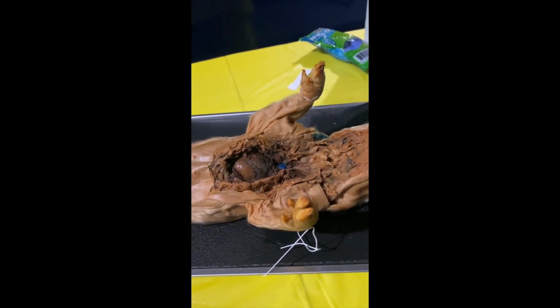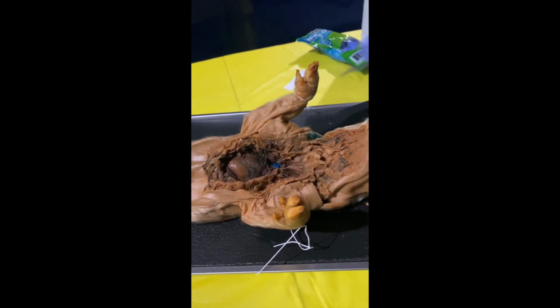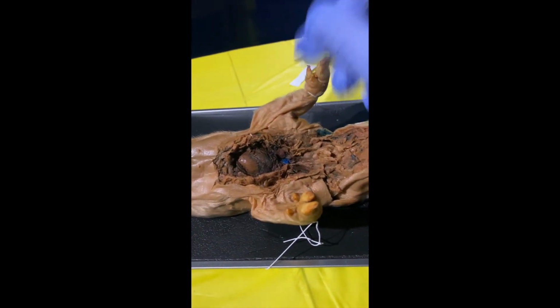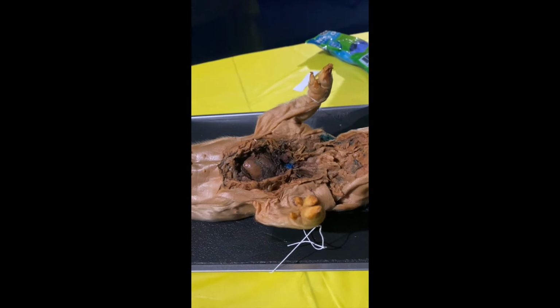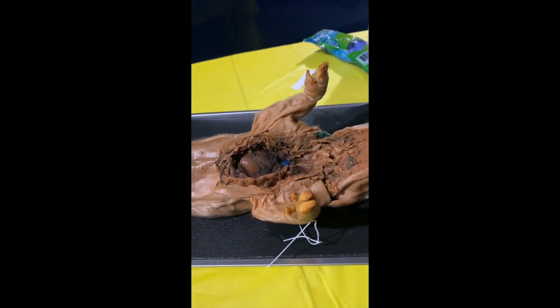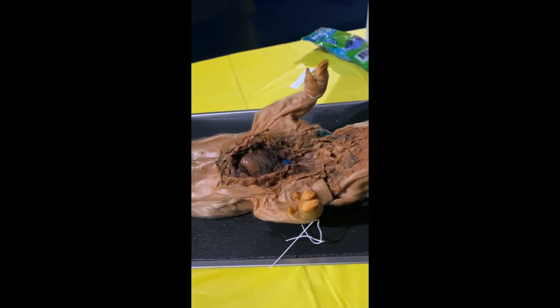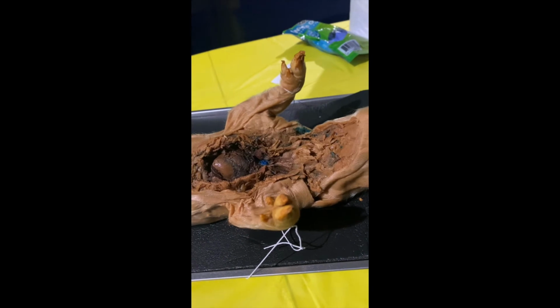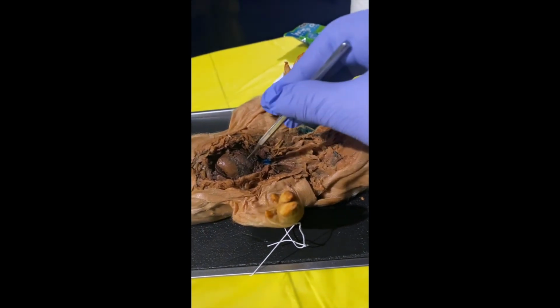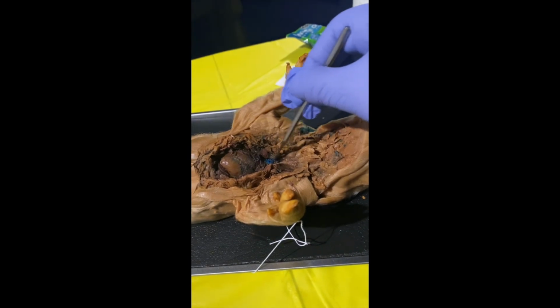The next bit is the superior vena cava. So the superior vena cava, of course, is towards the top because that's what superior means. And it brings deoxygenated blood from the head, neck, arms, and the thoracic region of the body to the right atrium. And then my superior vena cava, so this is, of course, the heart, should be right around here.